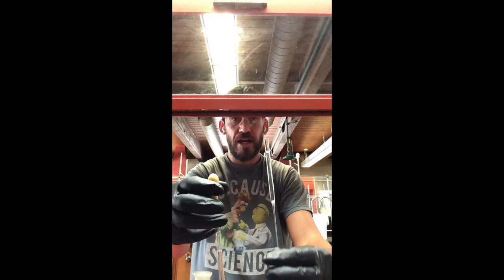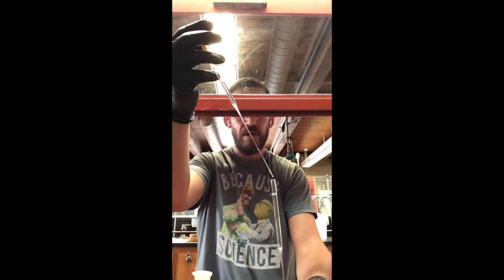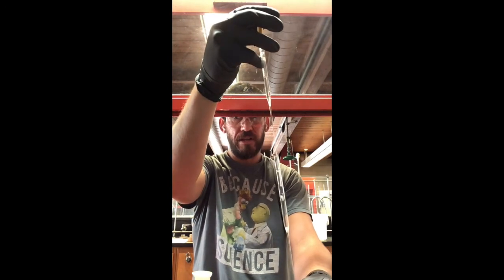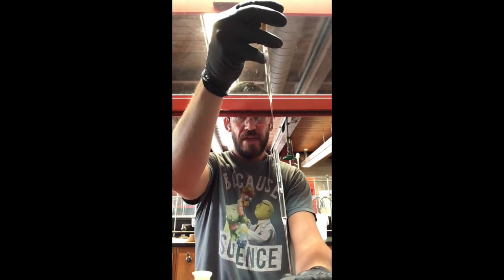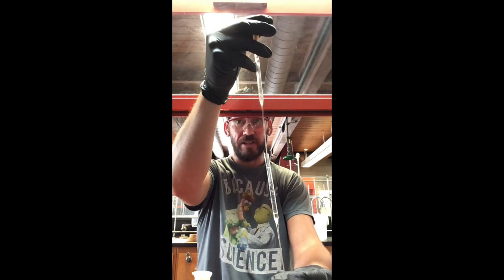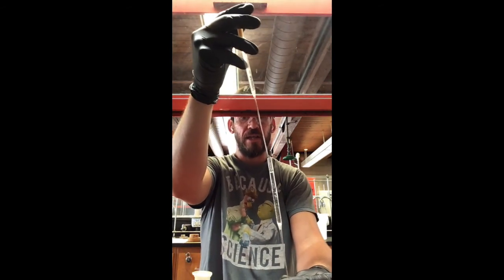And I've got my sodium sulfate methylene chloride solution here, and you can see that solid material on the wall of that right next to the E on my shirt. That is the sodium sulfate, and that's what I didn't want to go inside of my Erlenmeyer flask because that would add to the mass of the so-called caffeine that I extracted.